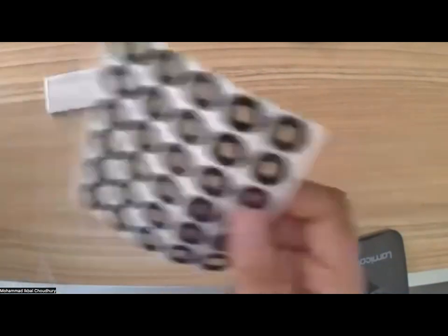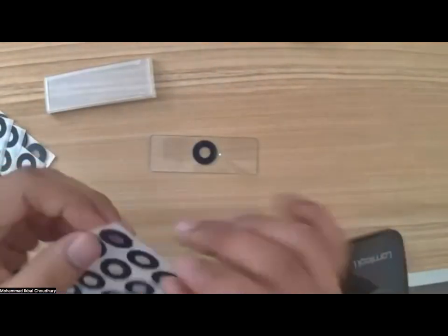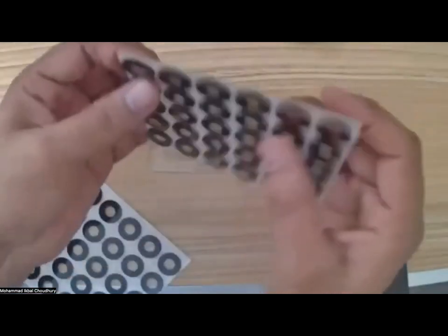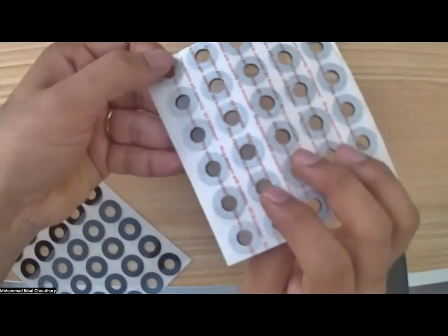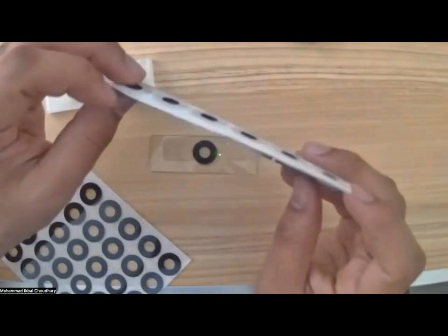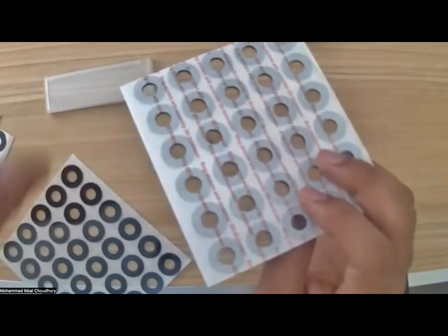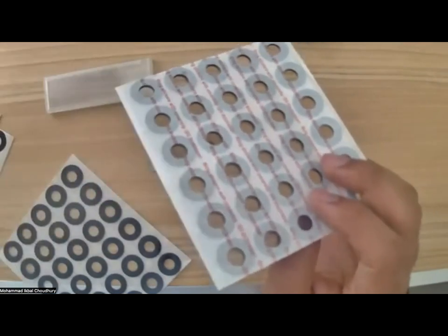Okay, yeah. So there are 3 kinds of ring stickers that Foldscope Instruments gives you. One is a tall one. So this one, I guess, is the one that gives you more spacing. Can you see that this is quite tall and there's more space here? Look for the thickness by hand also. You'll know how thick it is. The whole idea of this ring sticker is to make a tiny pocket on the glass slide so that you can place a sample in there that is sealed from the top.